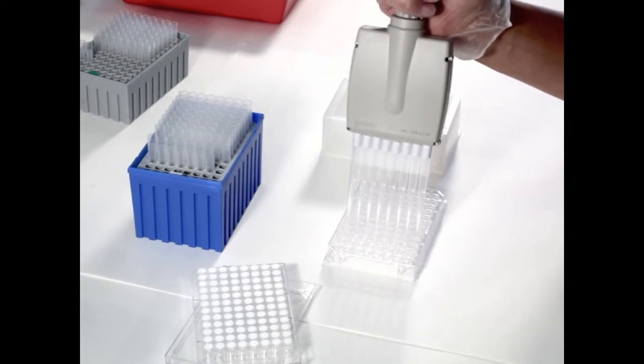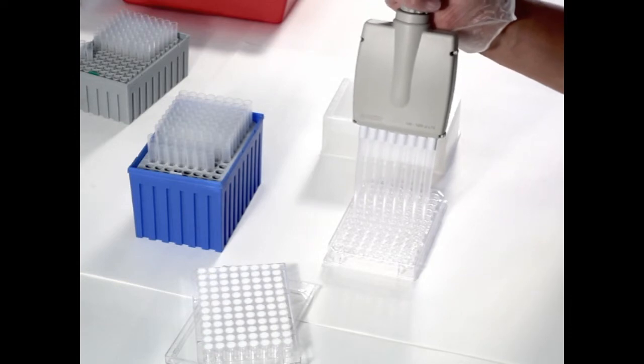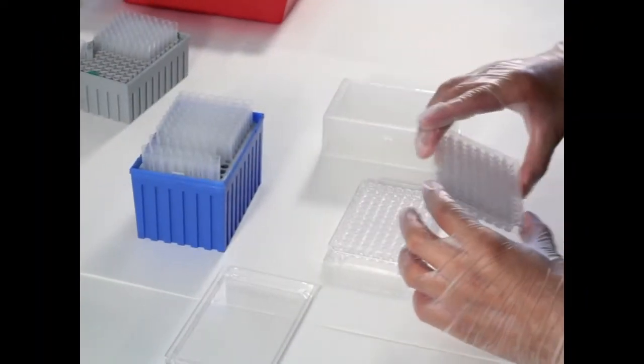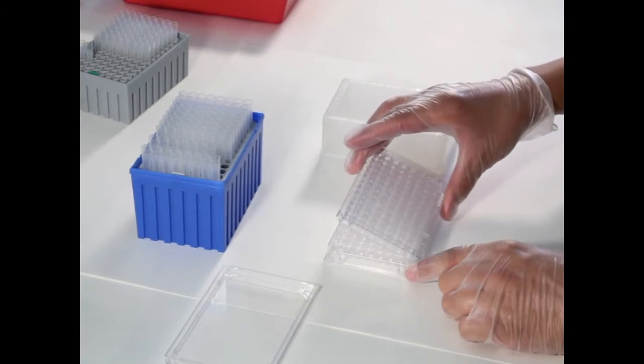First, 200 µl of hydration buffer solution is added to each well of the support plate. The top plate is then attached to the support plate and left to hydrate overnight.